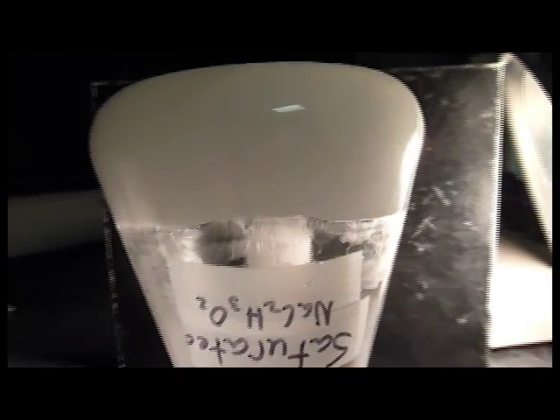Remember how it was a liquid before? Now I can turn it upside down. It all stays right where it is.